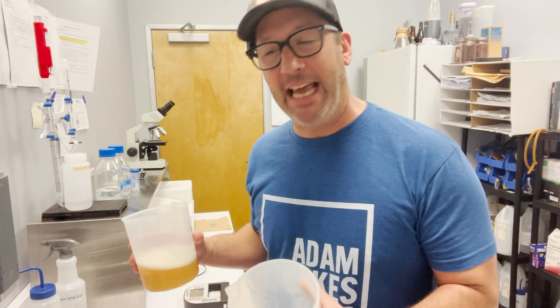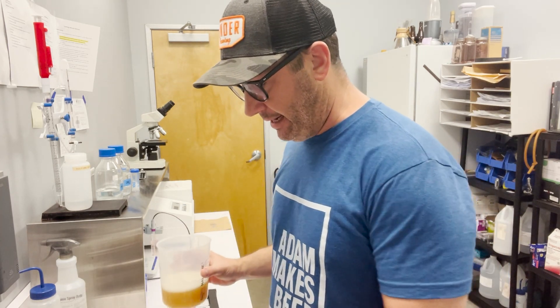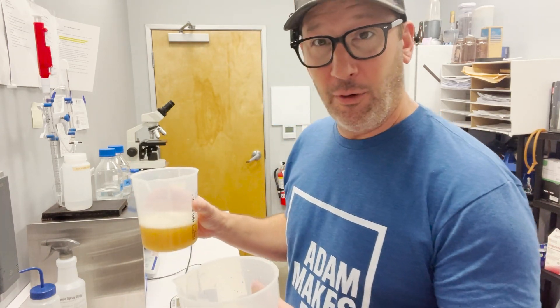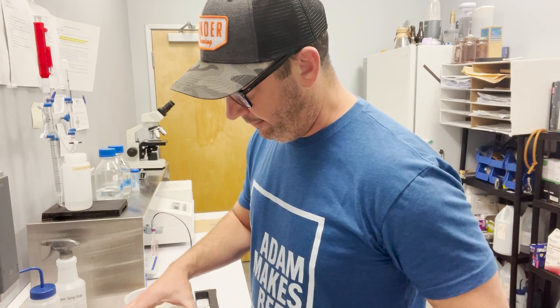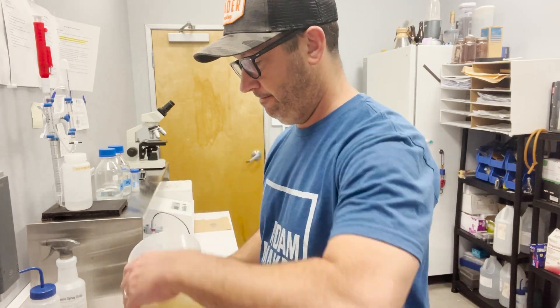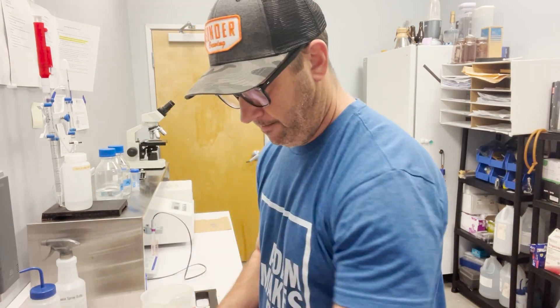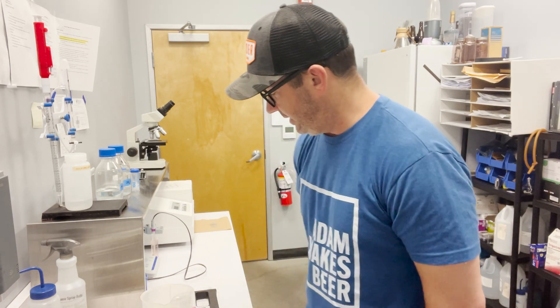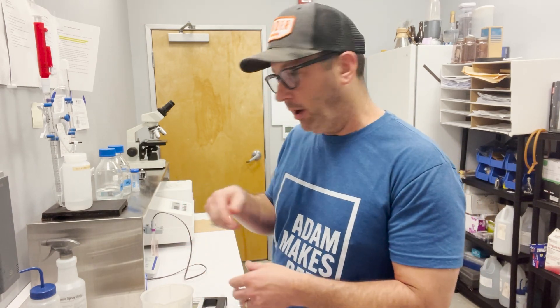This sample needs to be degassed in order to get an appropriate reading on our density meter and to get a good view of what's going on with the cell count sample. I have two Nalgene containers — there are a lot of different ways you can do this. I'm going to pour a little in to rinse out any water that's in this container, dump that, and then I'm going to pour this back and forth 40 times. I'll rinse the secondary container and put a little water in it, because after I'm done with the density meter I like to flush it with regular city water before moving on to alcohol and distilled.